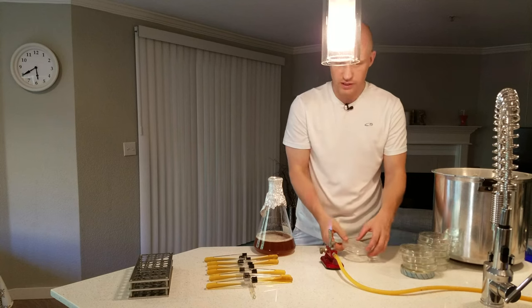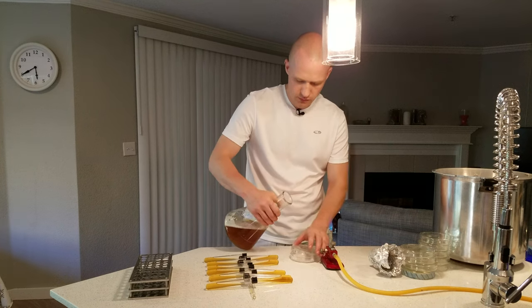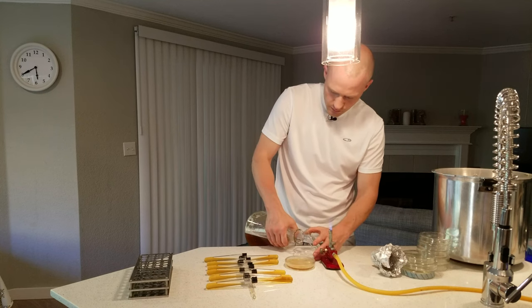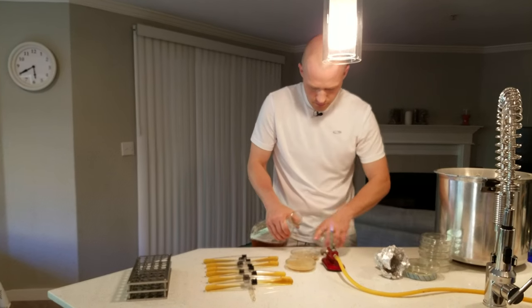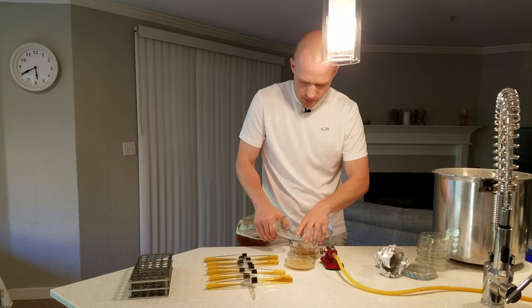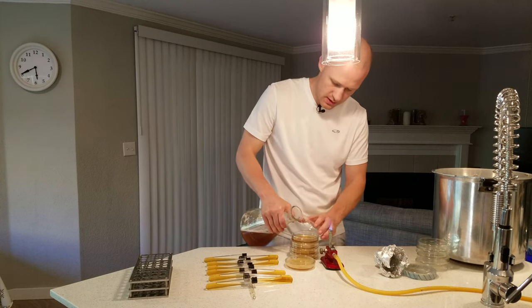We have our plates. We'll start with one plate, get it nice and close to the flame — same with the bottle. I'm going to pour about 15 to 20 milliliters in each plate, keeping it close, just covering the bottom of the plate. If you pour it when it's much hotter than this, you'll have an excessive amount of condensation inside your plates.